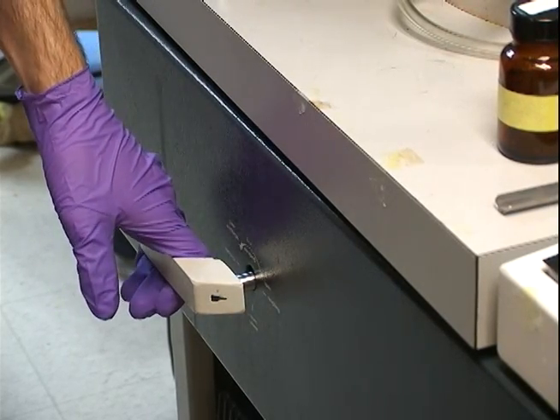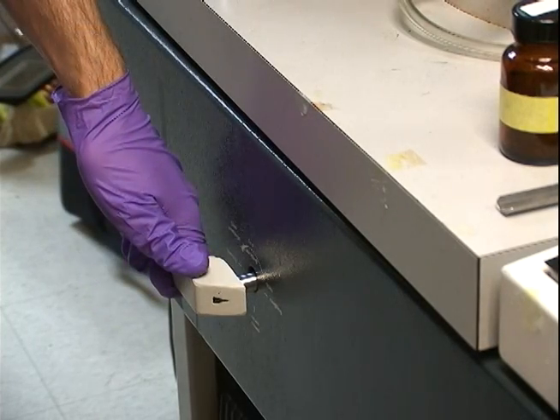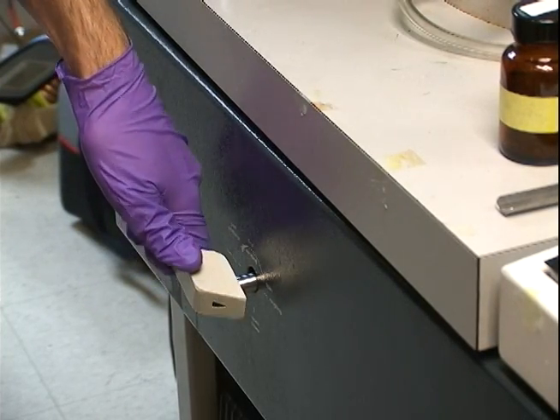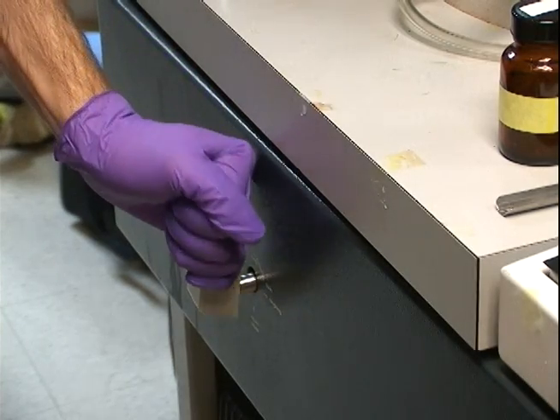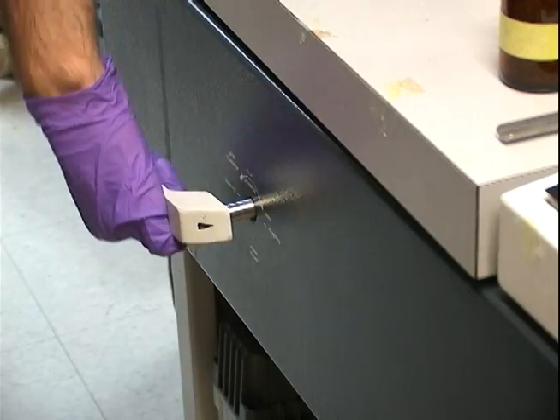This takes probably close to five to ten minutes for this particular pump, at which point the second pump is then turned on by switching this over this way. This one will pull the pressure down below 1 × 10^-5 torr.